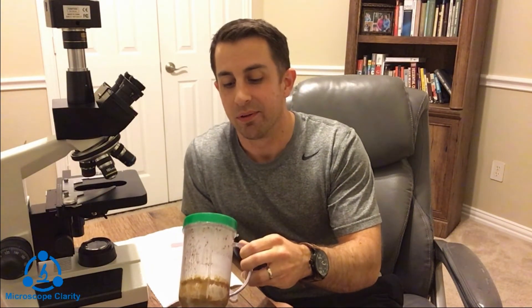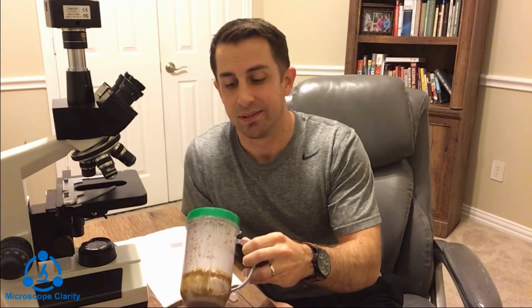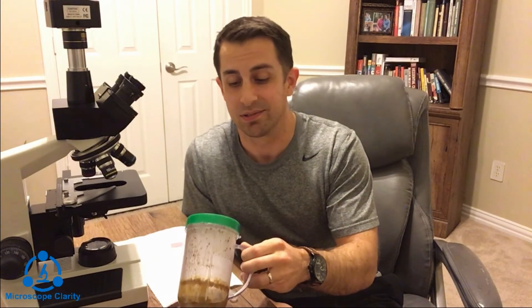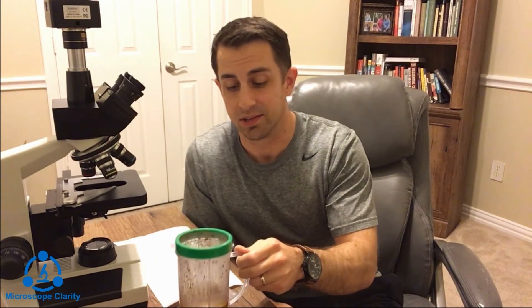So we have an old smoothie that my wife left out and forgot to clean out. It's been growing, just sitting out for a couple of days now. It looks disgusting, it smells disgusting. So there's definitely going to be some bacteria in there and we are going to put it under the microscope and see what we can see.